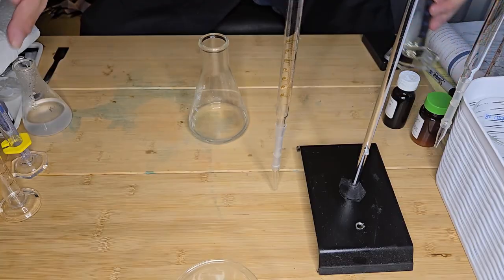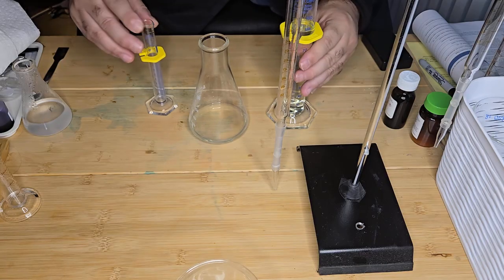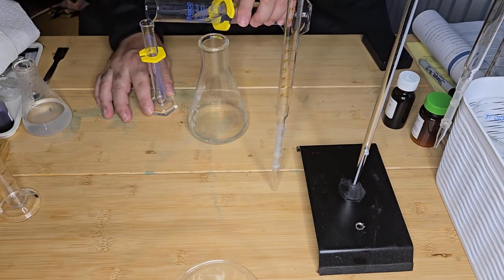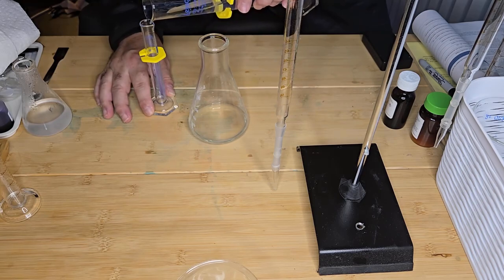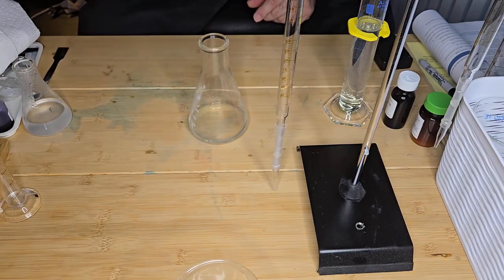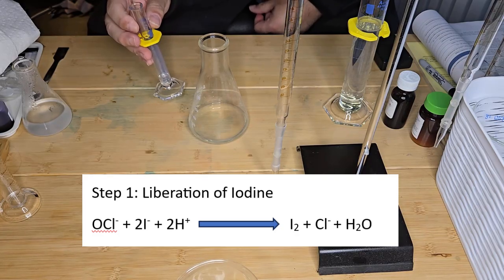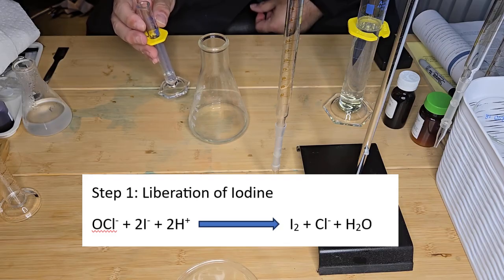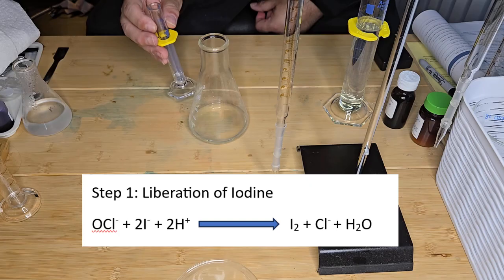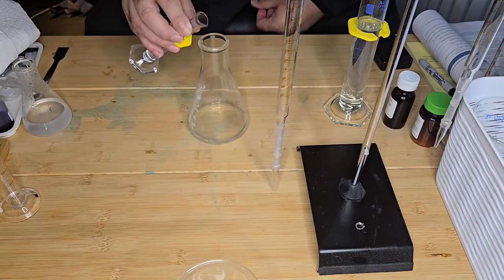And now I'm going to add 2 mLs of my bleach into the conical flask. I have my bleach here, and I'm going to use the same measuring cylinder I just used for my glacial acetic acid, and I'm going to measure out 2 mLs. Again, I want it as accurate as I can. That's 2 mLs. And when I add the bleach to the flask, the solution is immediately going to turn dark brown as the chlorine bleach oxidizes the iodide ions to free iodine.